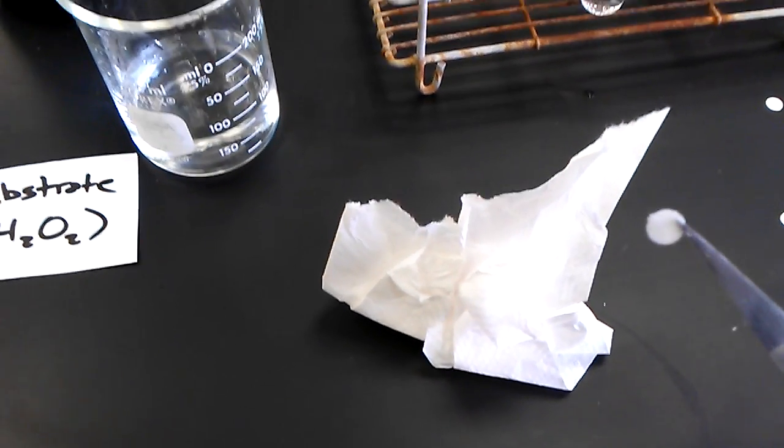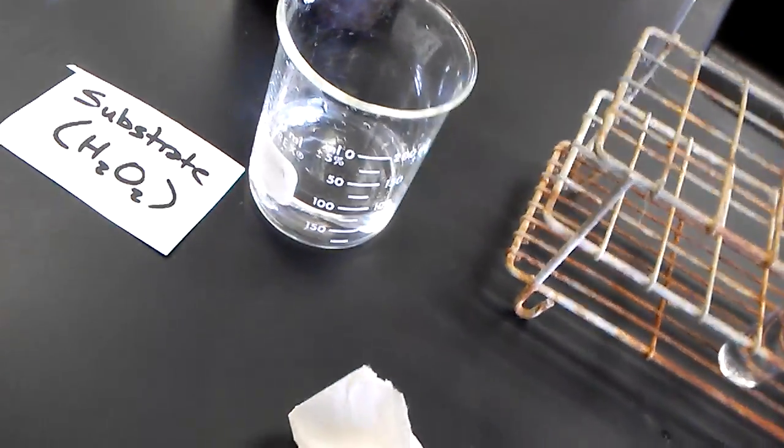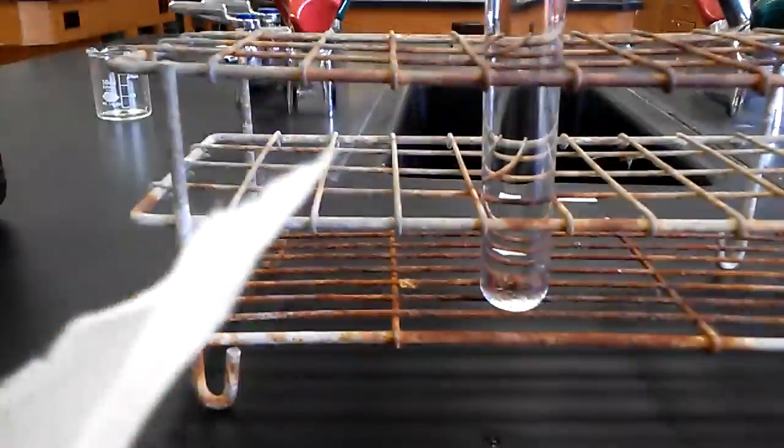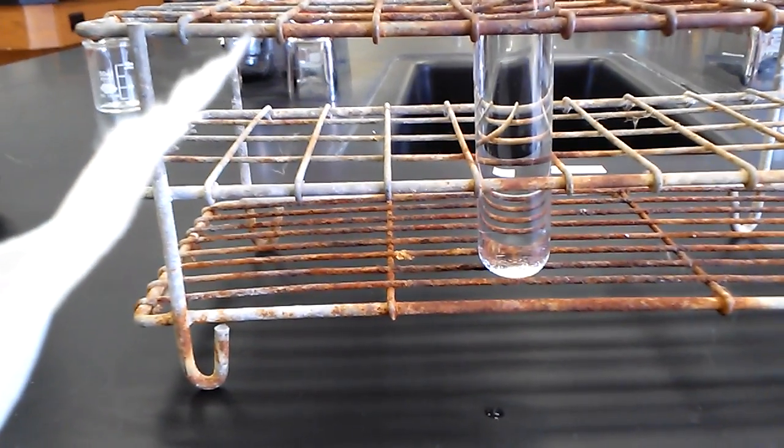So now we're ready to put this into our test tube. We want it to sink to the bottom. There it goes. And now it has sunk to the bottom of the tube.